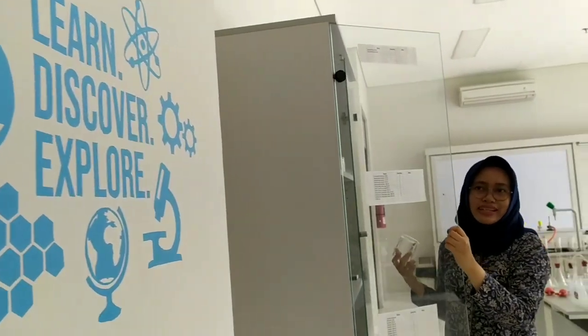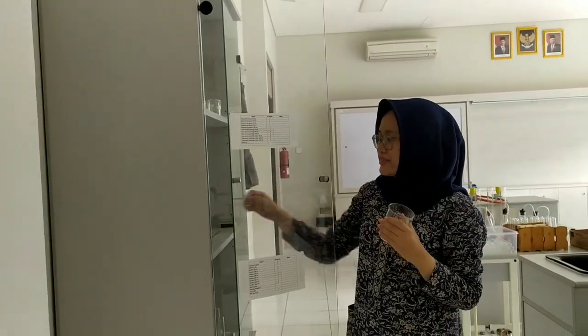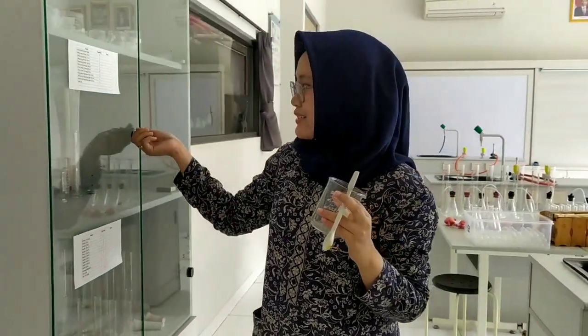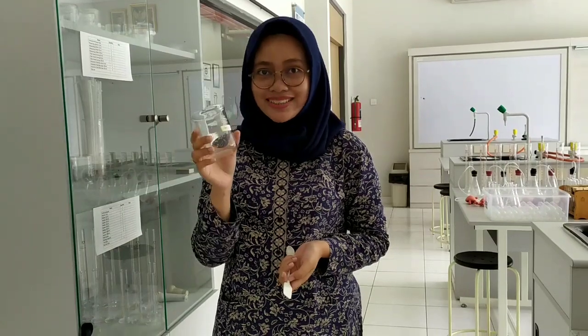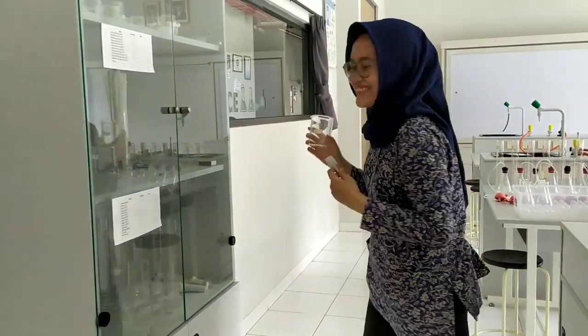So now we will try to take some soil from the garden. I'm using the bigger glass and also a spoon. Let's go to the garden.